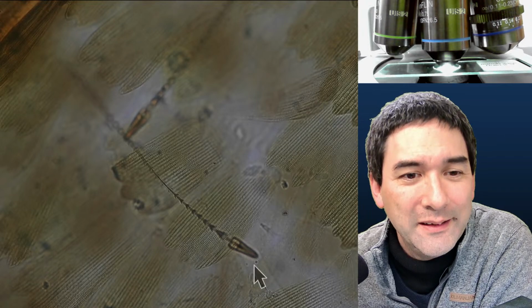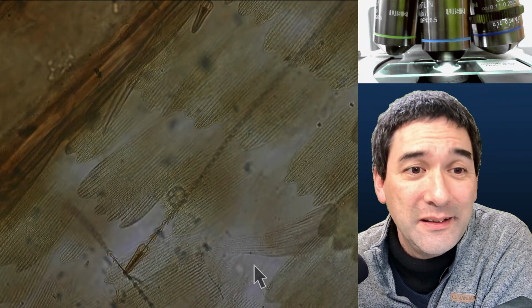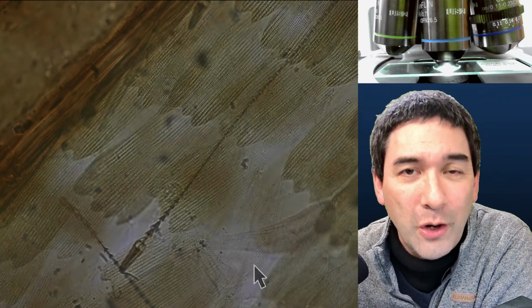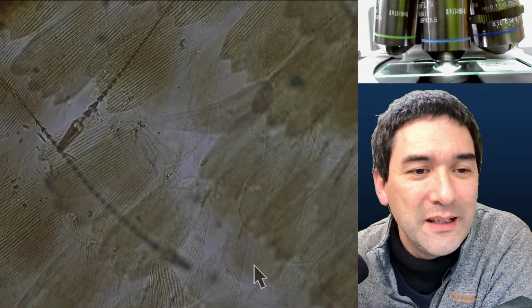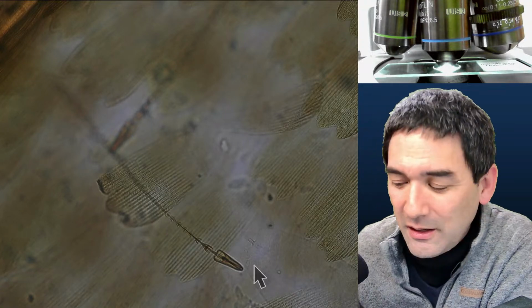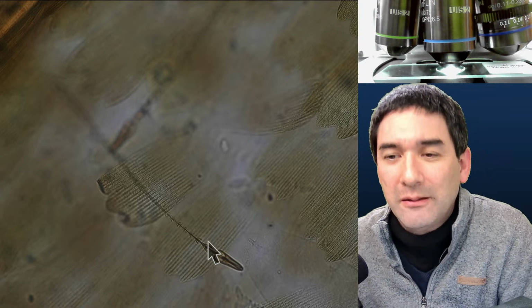The thing is, evidently the company who made and prepared those specimens kept their butterflies, and it must have been contaminated by one of those larvae, because they eat insects as well, right? So it was quite fascinating. But these here again that you see over here, those setae are essentially the hair of the larva of a carpet beetle or museum beetle.